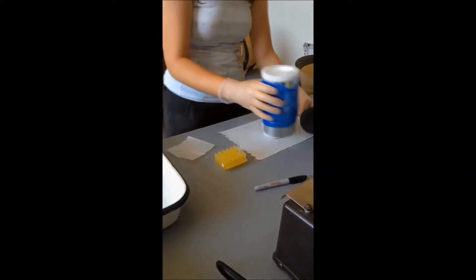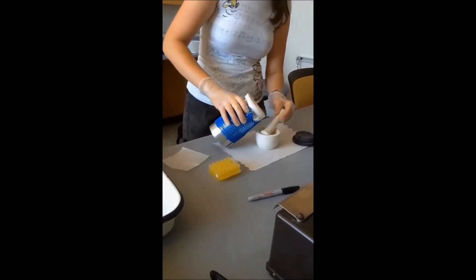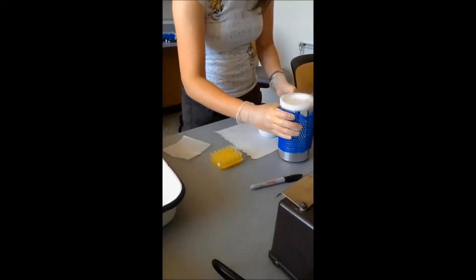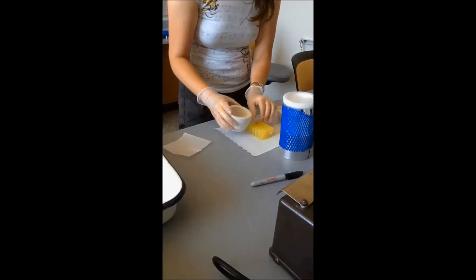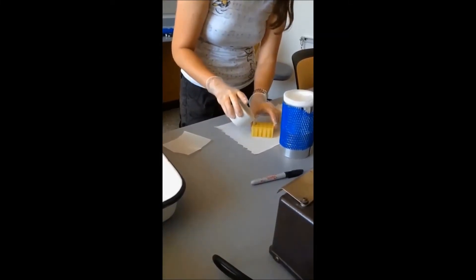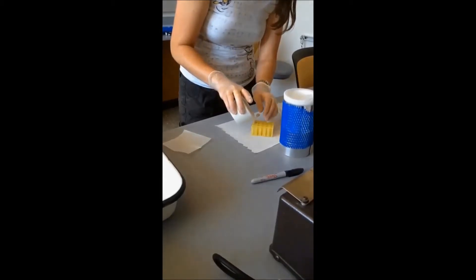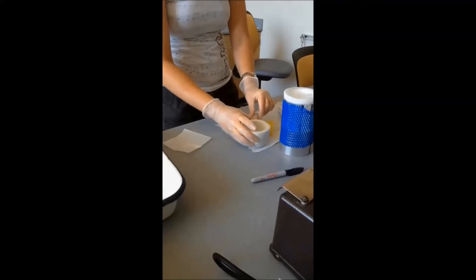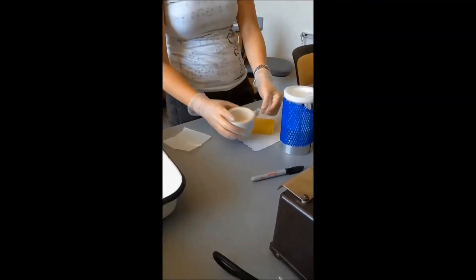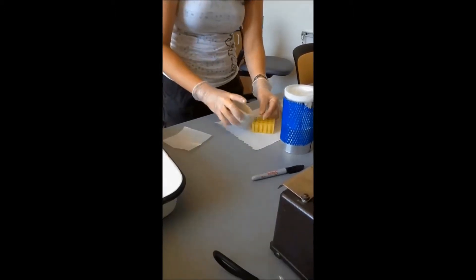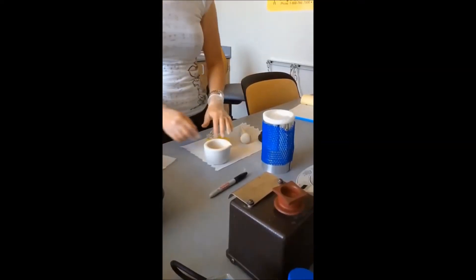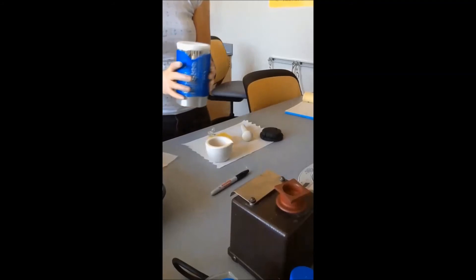And we'll add a little liquid nitrogen to the mortar to aid in transfer. I found that pouring it onto the pestle helps to prevent any splashing of the sample. And then we just pour it in as much as possible. And that's about half in one, and then we'll go ahead and do half in the other one. So we've poured about half into our first container and we'll add a little more liquid nitrogen and add it to our second container.